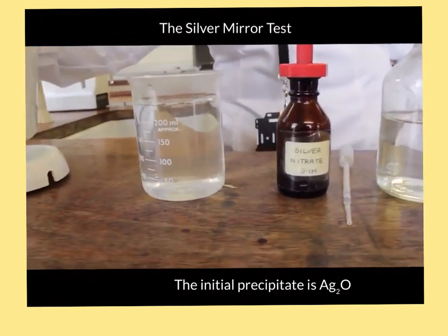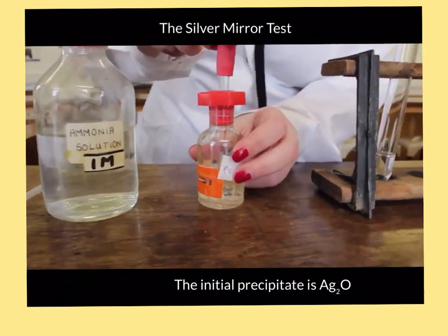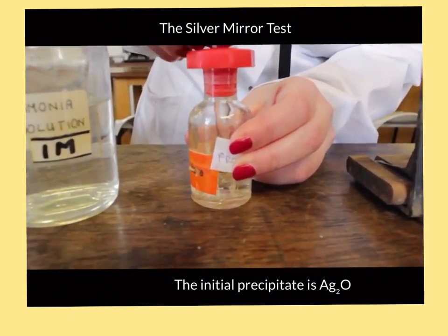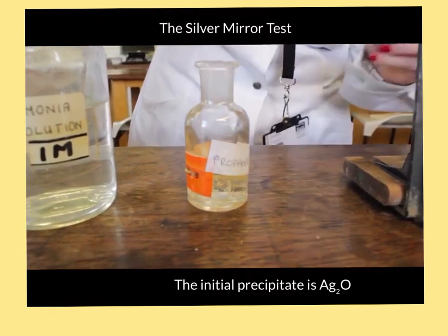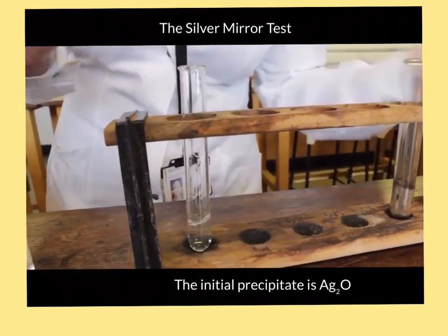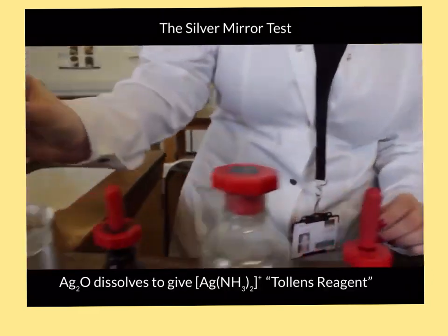So, boiling water ready in our beaker. We now take our propanal. You want to add about 10 drops and you need to add these quickly. Okay? Quickly, bung on, give it a good shake, place in the water.